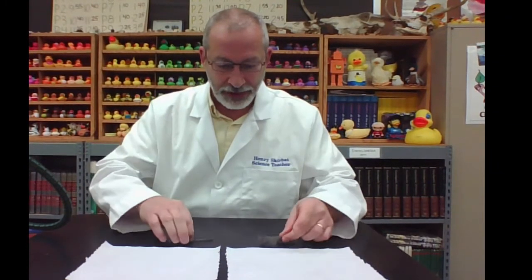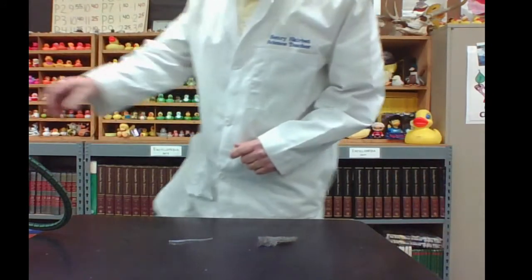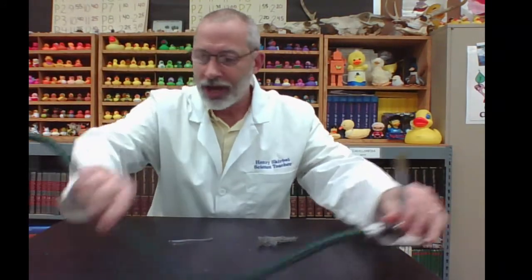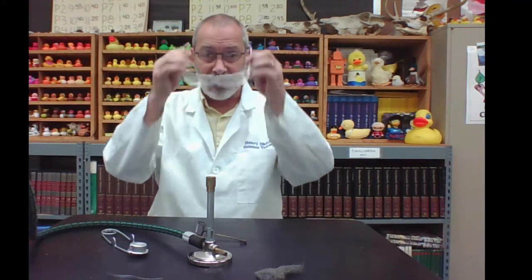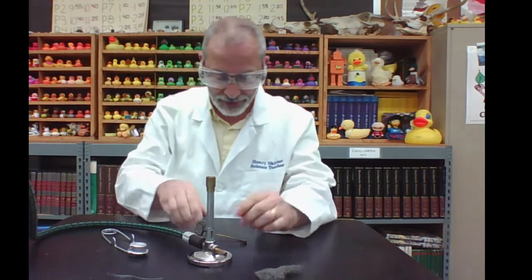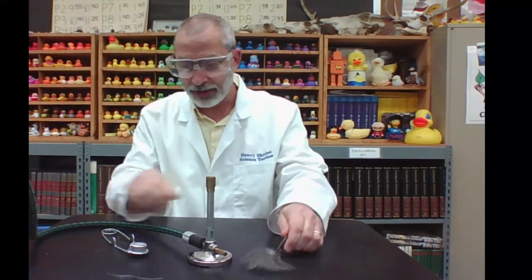And now comes the fun part. We're going to be getting rid of the paper towel because paper towel is a flammable material, and we're going to get the Bunsen burner ready. So let me remove the paper towel from our work area. As we get ready setting up the Bunsen burner, good opportunity now to review the proper steps of lighting it. I have the burner, the striker, my safety glasses — I'm going to put them over my vision glasses — and we also have forceps to hold on to each of these elements as we put them into the flame.